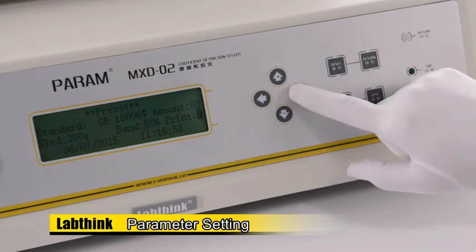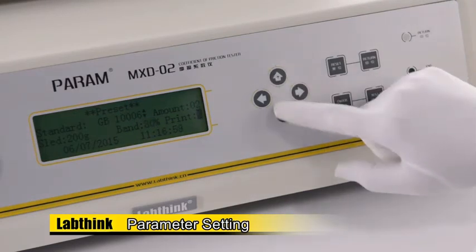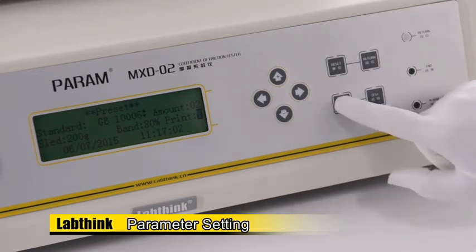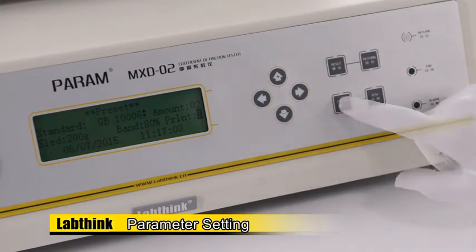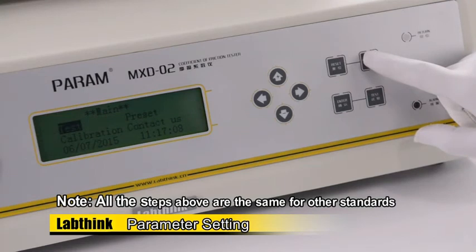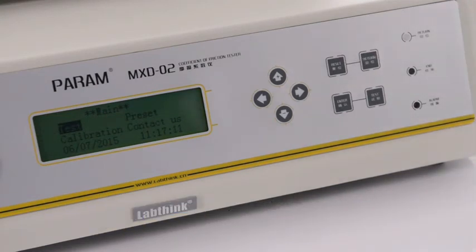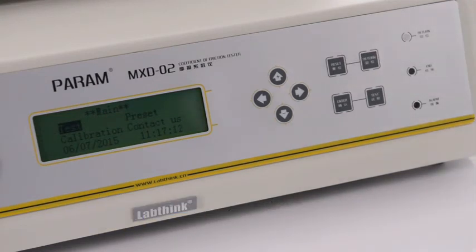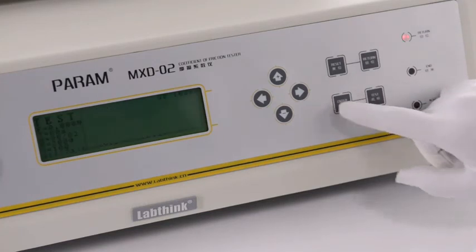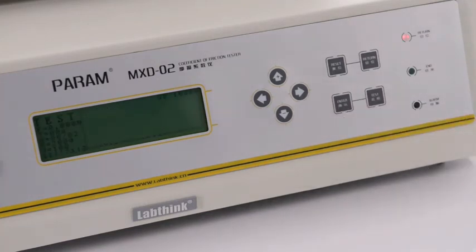Select Yes or No for the print option and press Enter to save the setting. Press Return to exit the preset interface. Move the cursor to Test in the main interface by pressing the left or right arrow keys, then press Enter to enter the test interface.